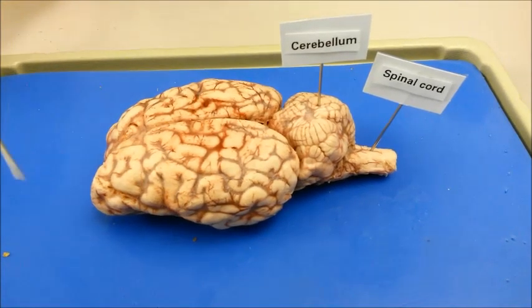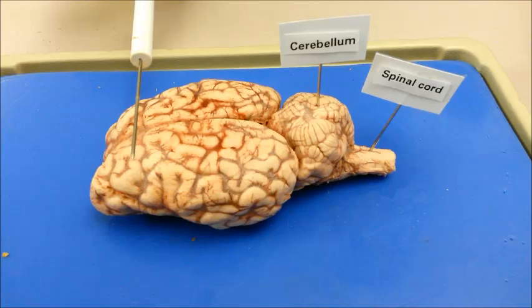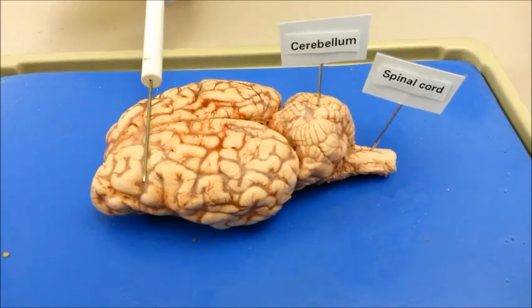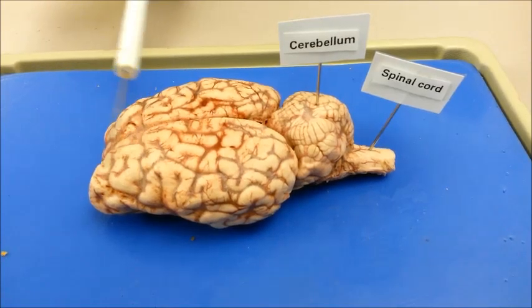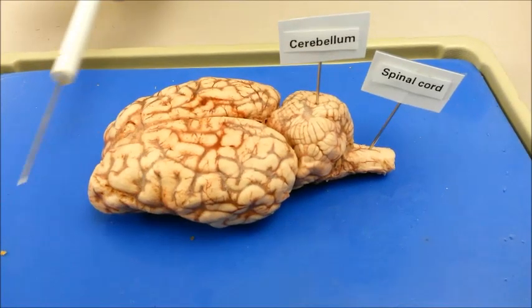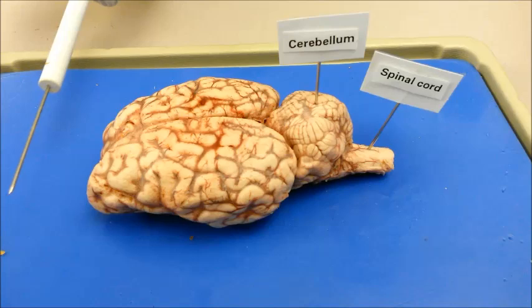The frontal lobe, which is located in the front portion of the cerebrum, is involved in problem solving, voluntary muscle movement, reasoning, and speech abilities.